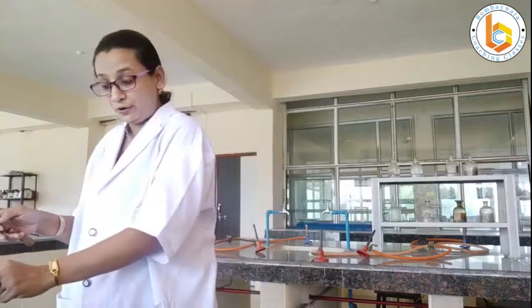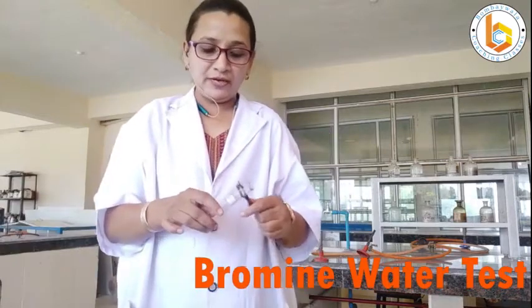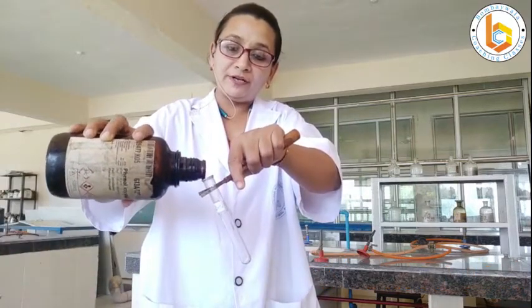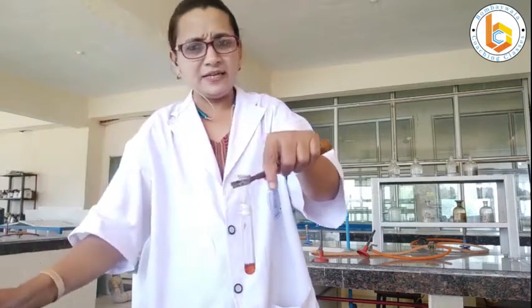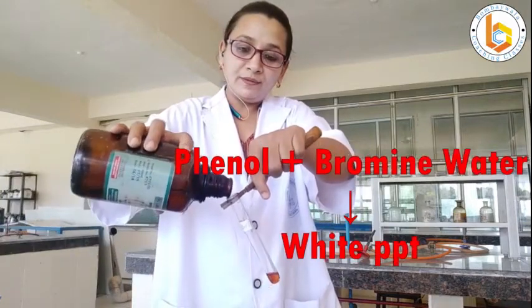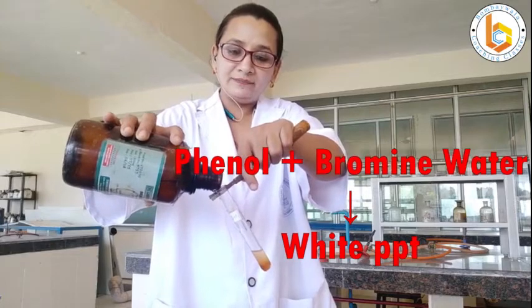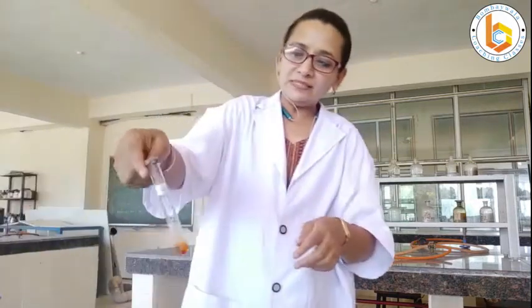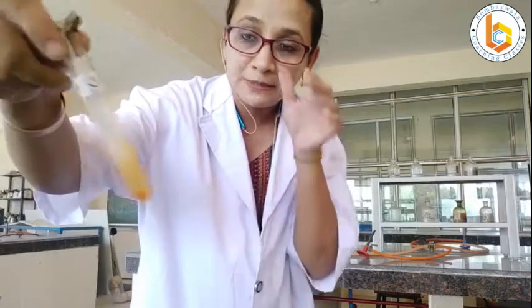Now let us go on to the last test — the bromine water test for phenol. Take a small quantity of phenol; for a qualitative test you don't need to measure exactly. To this, add excess bromine water. The bromine water gives a yellow shade. Shake it well, and you will get a white — or yellowish-white — color precipitate.